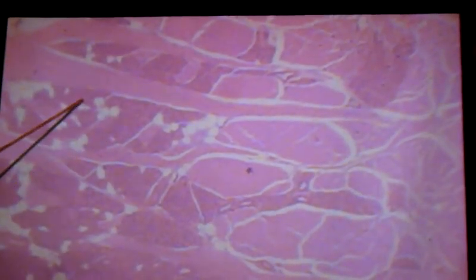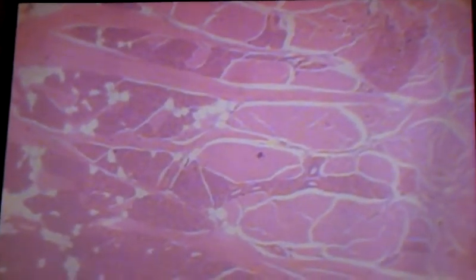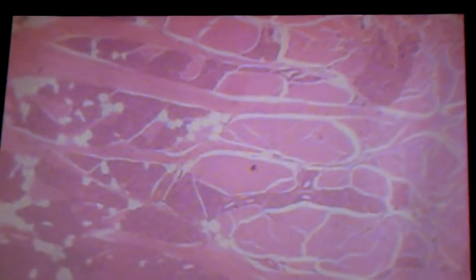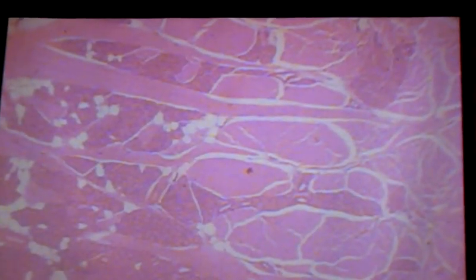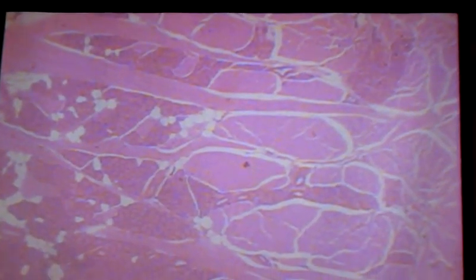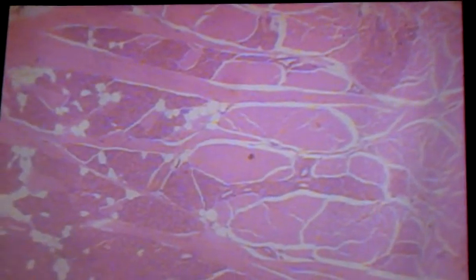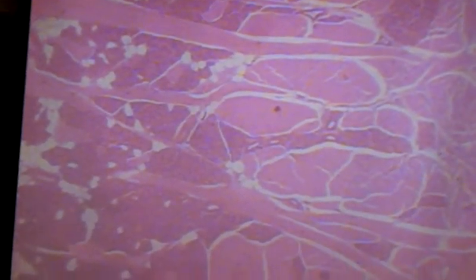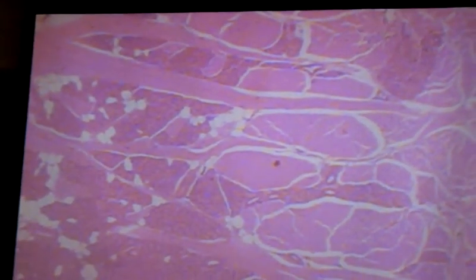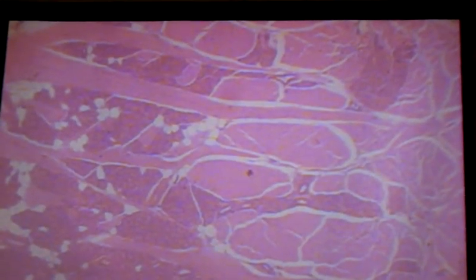This is glandular material with adipose tissue mixed in. So the muscle fascicles are going every which way in here. Some are cut nice and longitudinally, others are cut in cross-section, others are cut obliquely. Mixed in with that would be that glandular material that's secreting, depending on the gland, sometimes a serous type of fluid, sometimes a mucus type of fluid. And in infants, the glands also secrete lipase, an enzyme that breaks down fats.